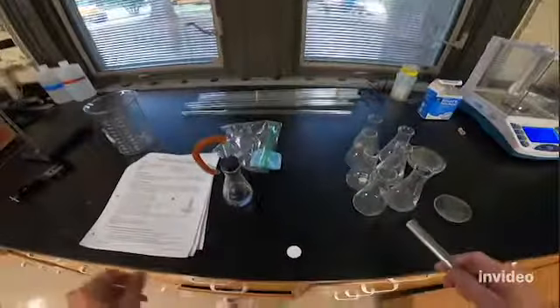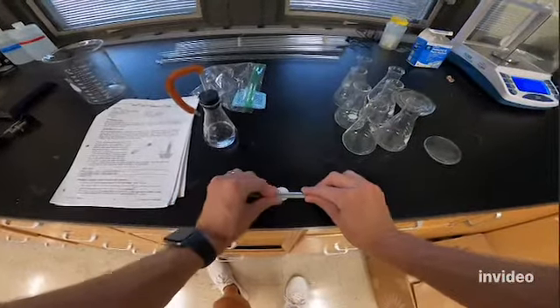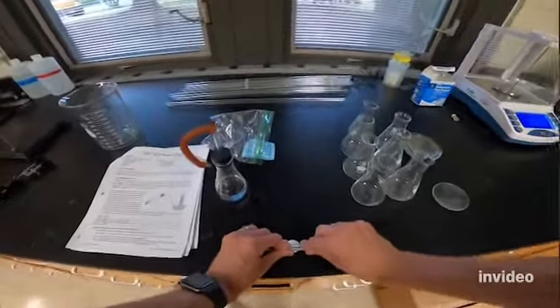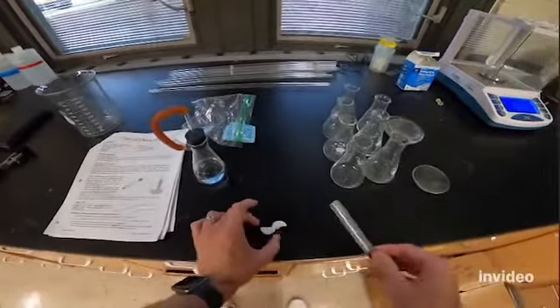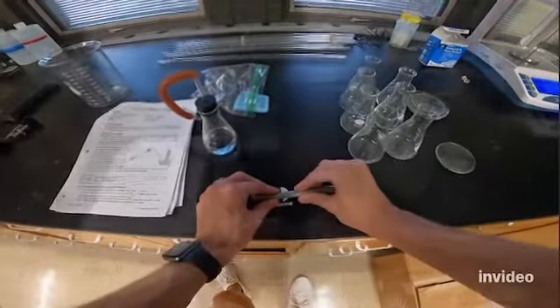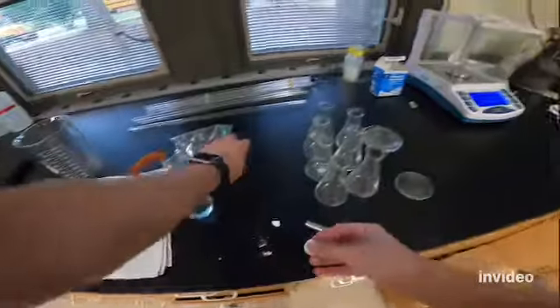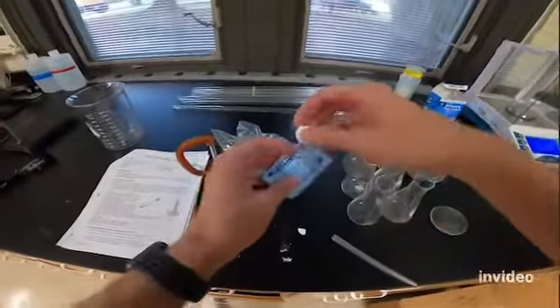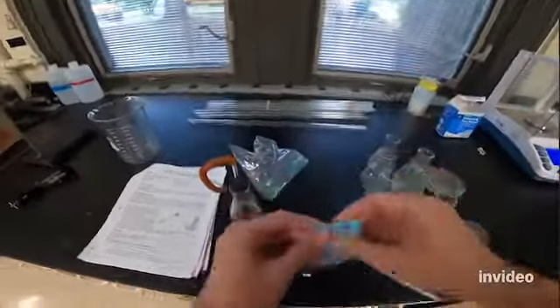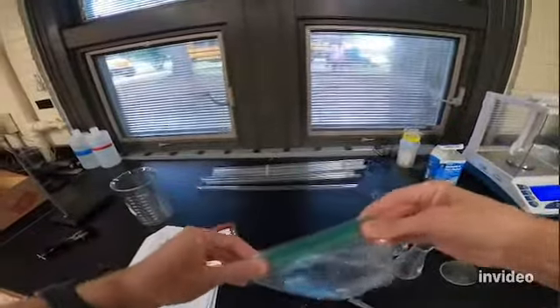So take an entire Alka-Seltzer tablet. I'm going to use a scoopula, just kind of use the edge of this to push down and break it in half. Okay, now I have half an Alka-Seltzer tablet, and I'm going to do that one more time. And so now I have a fourth of a tablet. You guys can share those. So I'll put that here, and I will leave this over here as well. Okay, so now I've got a fourth of an Alka-Seltzer tablet.